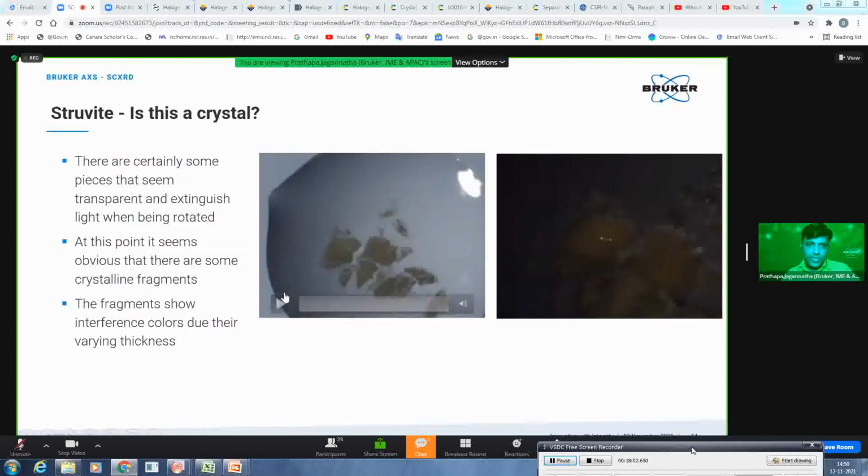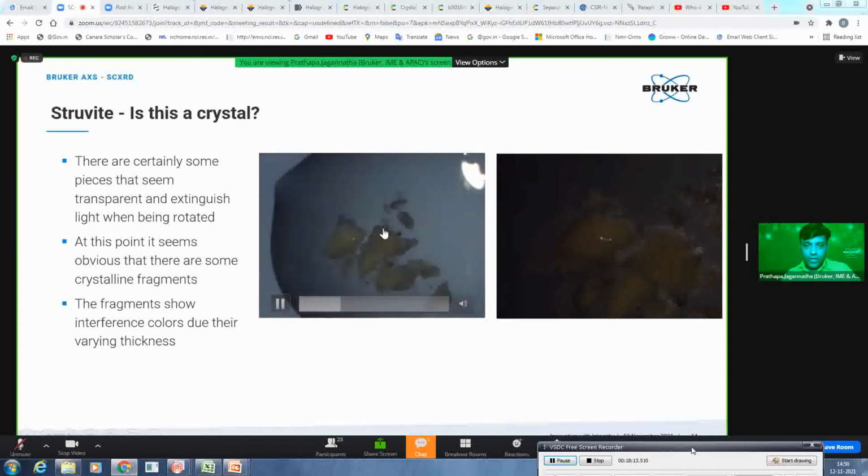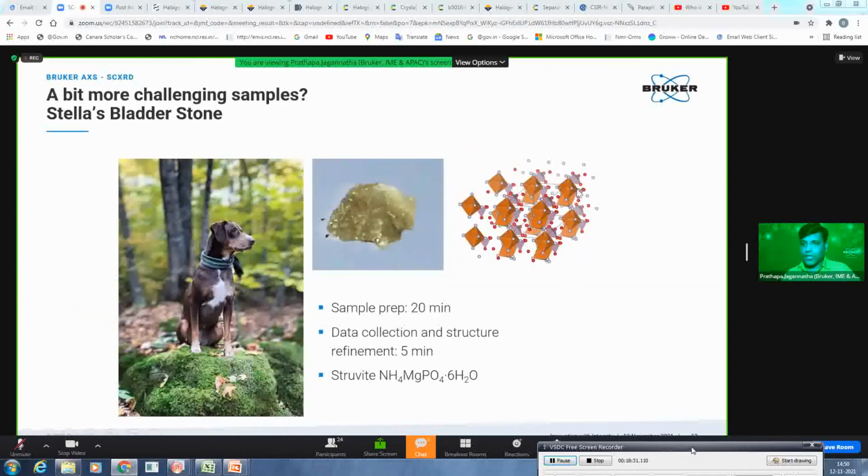What he did was he broke that mass under the microscope in Paratone oil, and broke it into several pieces. And then he could see, when he rotated the polarizer and analyzer, some transparent crystals on the edge of these masses. So then what he did was, like for example, here you can see one of them. He picked up one such piece and put it on the diffractometer and solved the crystal within 5 minutes.